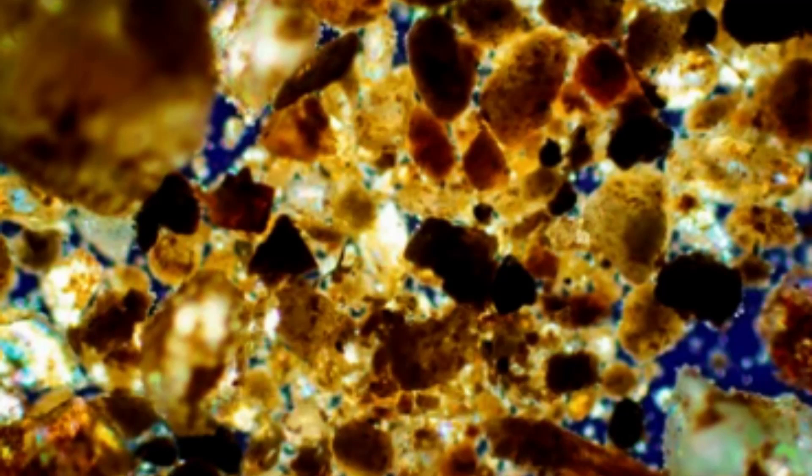Each mineral has a unique set of properties that can be revealed through the use of polarized light. For example, some minerals may display a specific color or pattern when viewed under polarized light, which can help identify them. Other minerals may exhibit a range of colors and patterns, which can reveal information about their crystal structure and composition. By examining thin sections of rocks under polarized light, geologists can gain insights into how the rock formed, including information about the size and shape of mineral grains, the orientation of mineral crystals, and the presence of any deformation features such as fractures or faults.